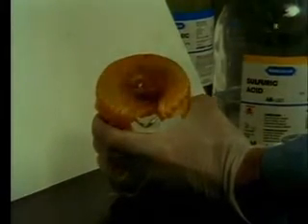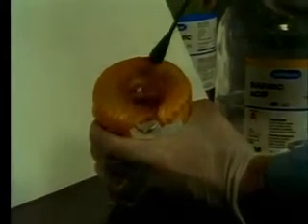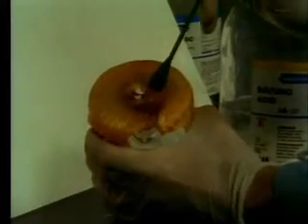Most important to remember is the destructive and irreversible effect of corrosives on human tissue. When a solution of 93% sulfuric acid is applied to chicken skin, the effects are obvious. The acid works to remove water from the skin until it is discolored and eventually destroyed.